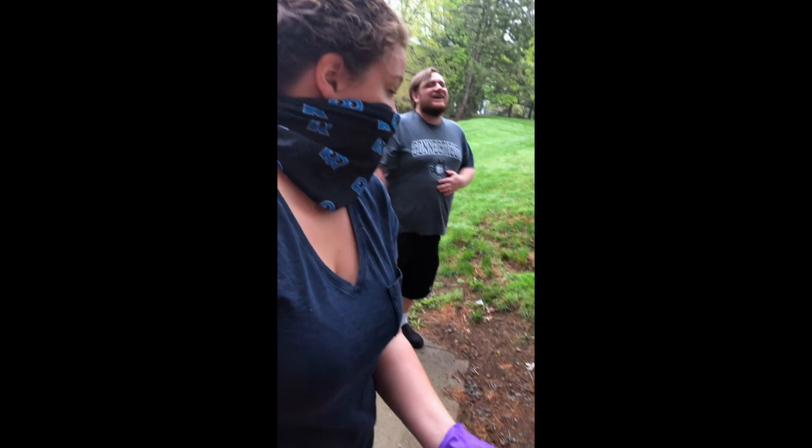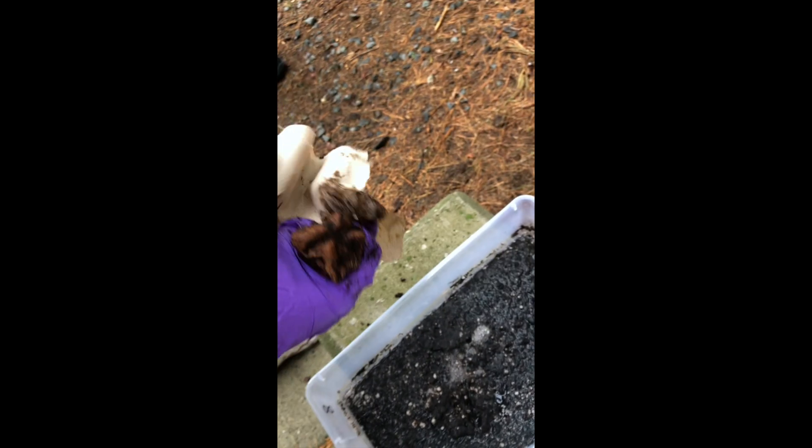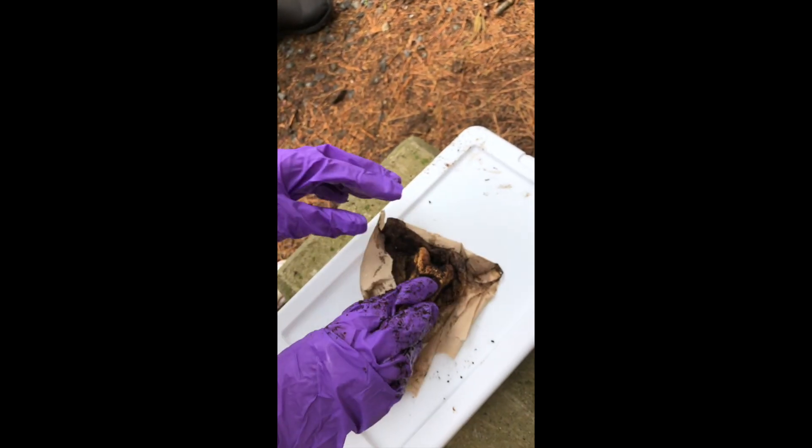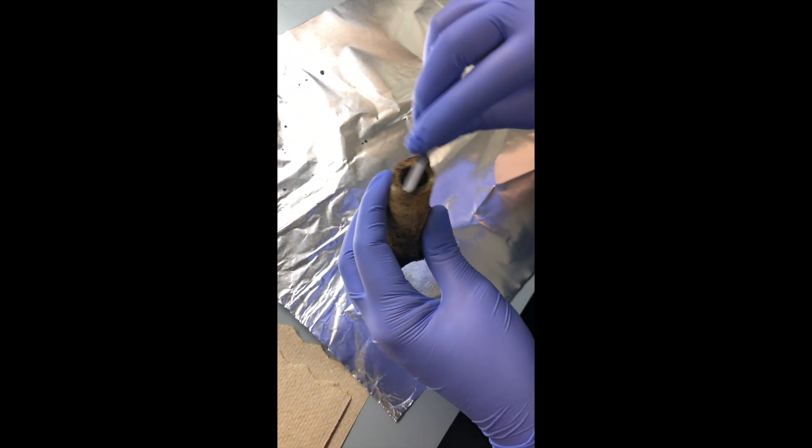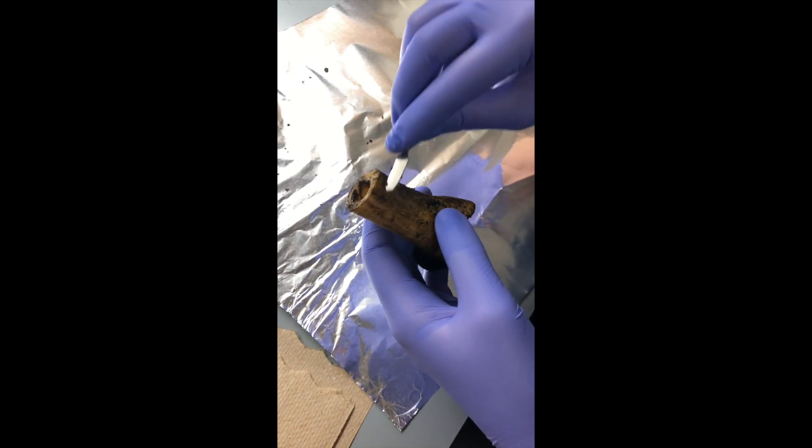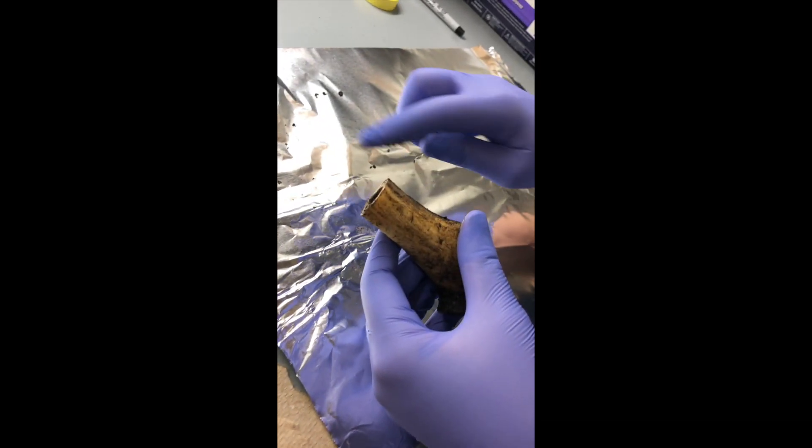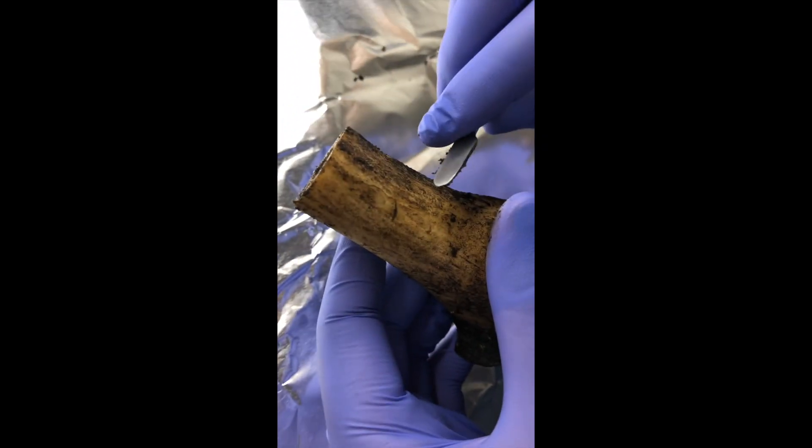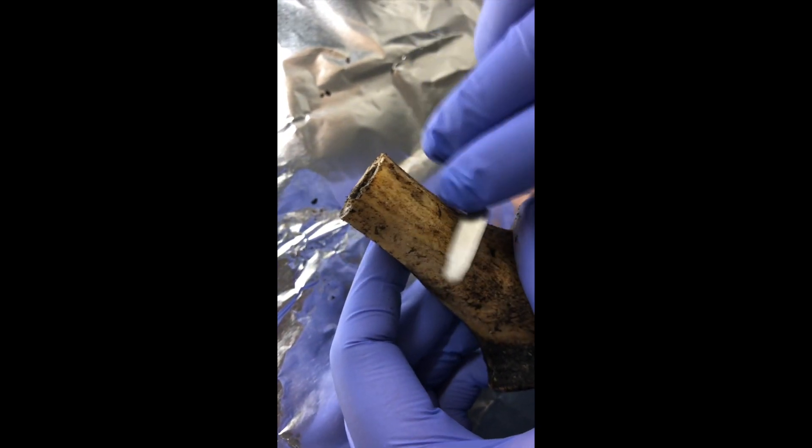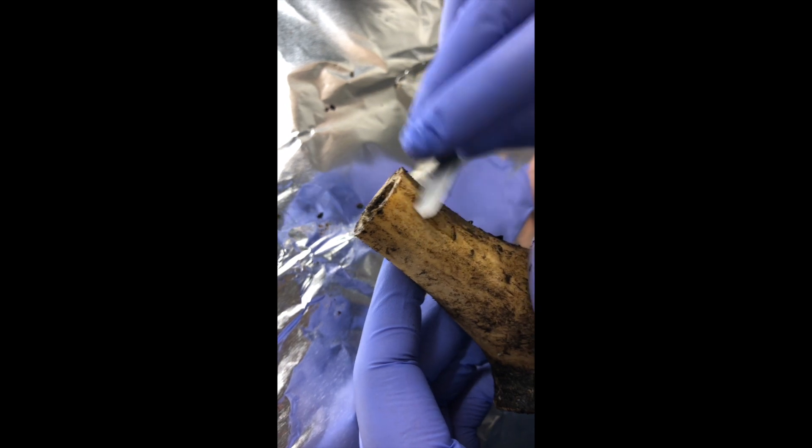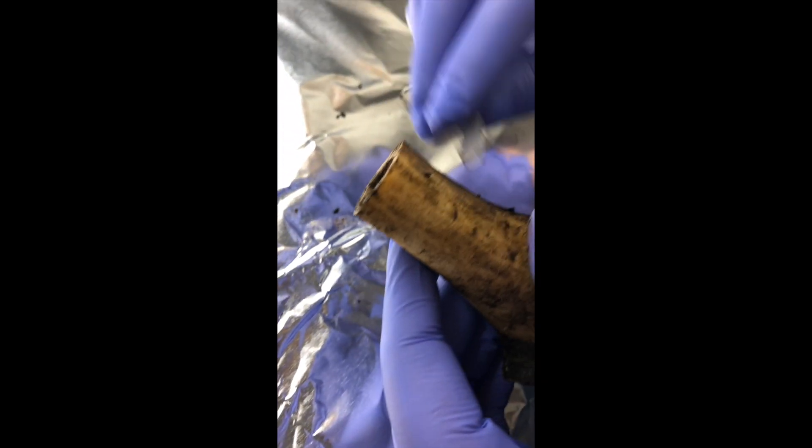Going in! Is the bone soft? No, it's not soft. No, it's not spongy at all actually. You can see there's still quite a bit in there, which we'll have to scoop out. They've all been removed from their respective boxes. Now it's time to dig in. We've all been thoroughly horrified. Right now I've just, or we have just taken the bone out of its box, and now we're just lightly cleaning off the surface so that we can take our bone sample without too much of the dirt left on it. Trying to remove this but without really scraping into the surface of the bone because obviously we don't want to disrupt that because that is what we want to test.